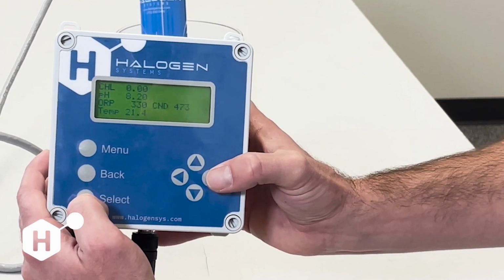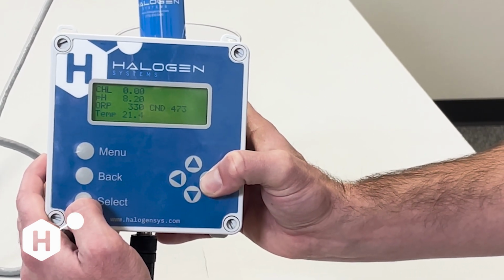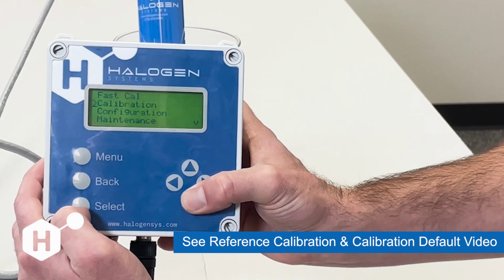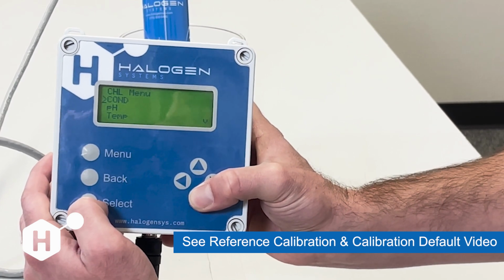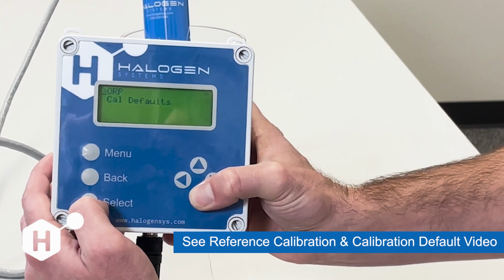So when we activate the long menu, holding select and right arrow for 2 seconds, our long menu is going to be activated, and you can see we have some additional options here. The first additional option is that we're going to be able to calibrate every single one of our individual parameters. So that's chlorine, conductivity, pH, temperature, and ORP.